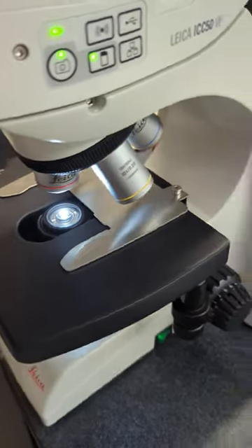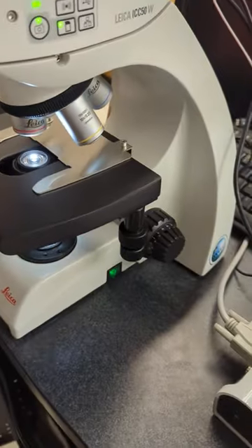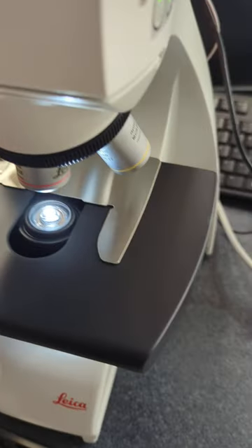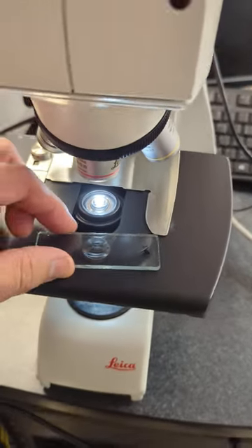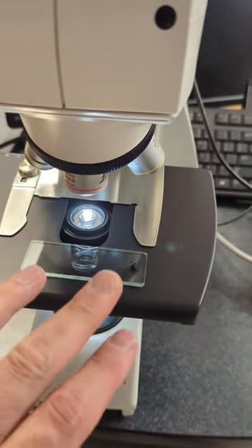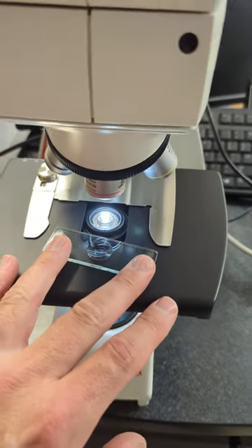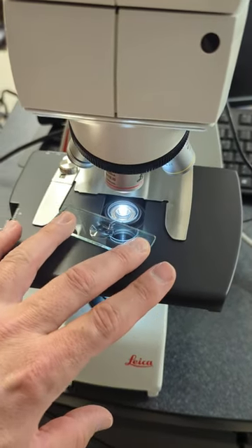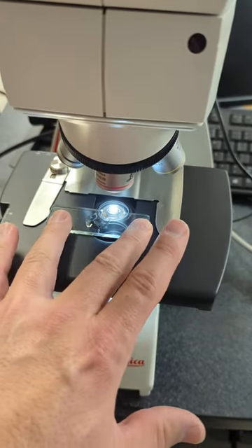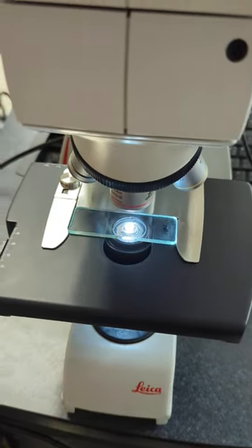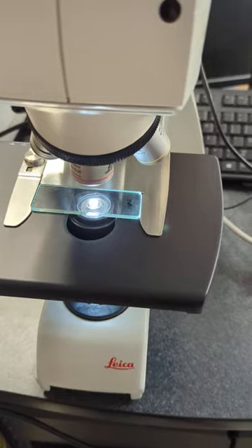For stage operation and focus operation, first loading the slide. These are designed for one-hand slide operation, so whether you use your left hand or right hand, you push against the left side with your left finger, then tilt the slide in just like that, and it stays right in there.